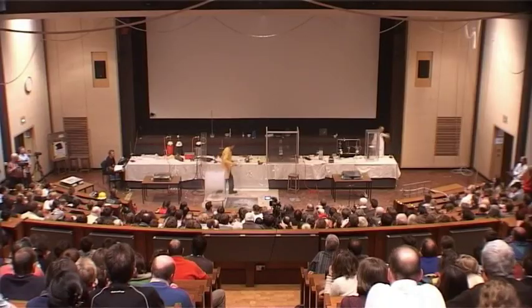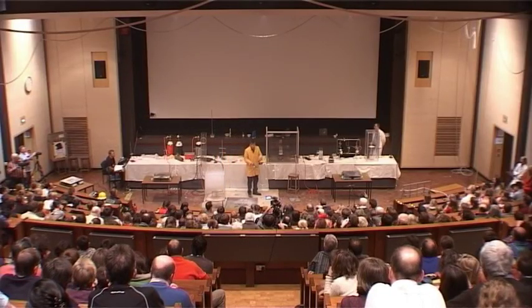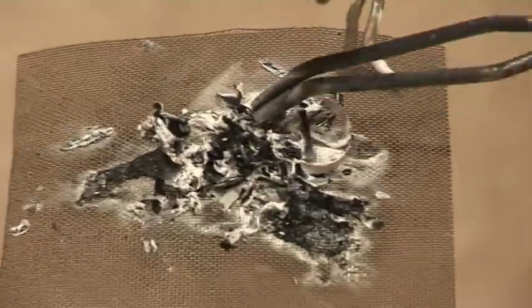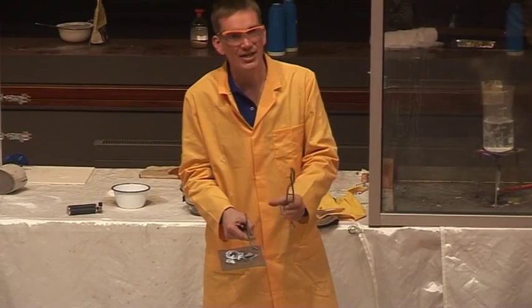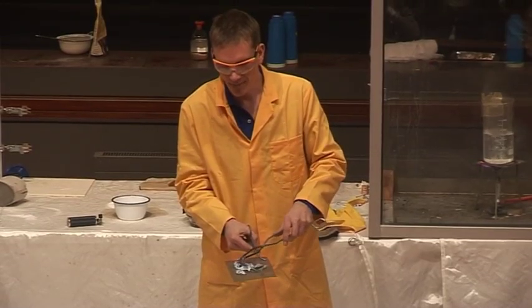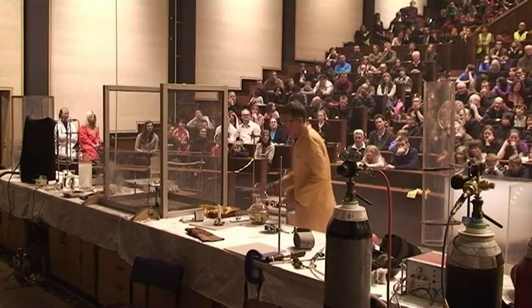And if we look at what's left, we see some white magnesium oxide, but deep inside here there's a lot of black. This black is carbon that's been formed when the magnesium has stolen the oxygen from the carbon dioxide, forming magnesium oxide and leaving behind carbon.